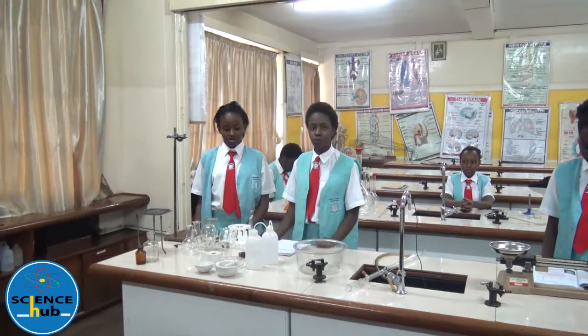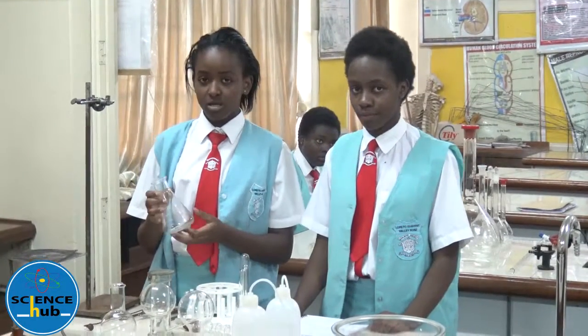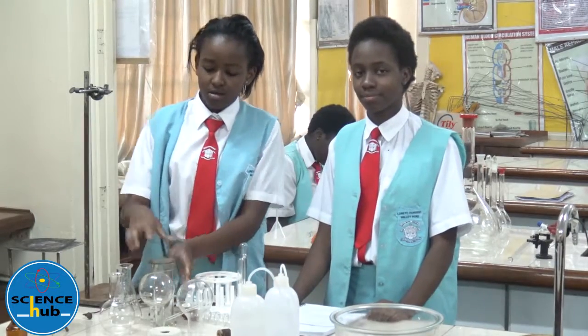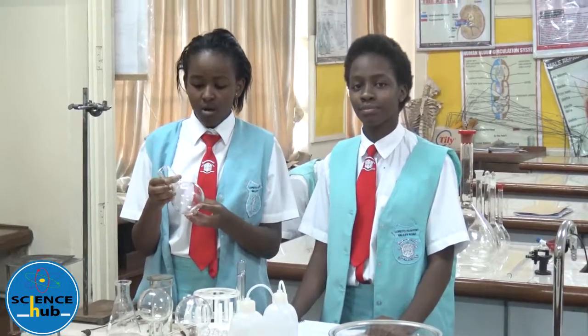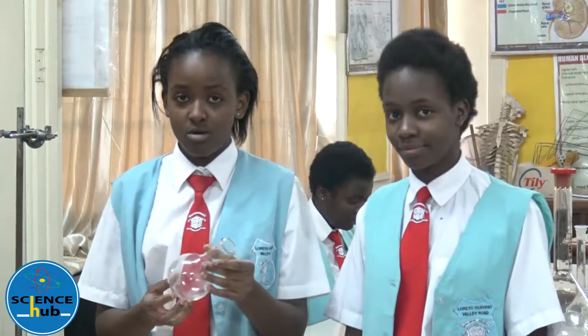Other apparatus are used for everything else apart from measuring. This is a conical flask used to hold liquids. This is a glass gas jar and this is the lid. This is a round-bottomed flask used for heating liquids. This is a round-bottomed flask with an arm, also used for heating liquids. This is another round-bottomed flask also used for heating liquids.